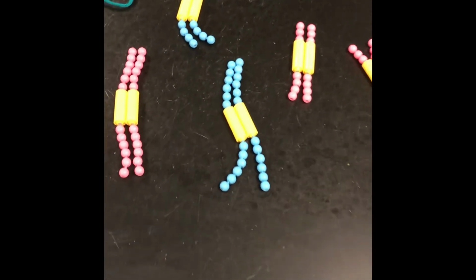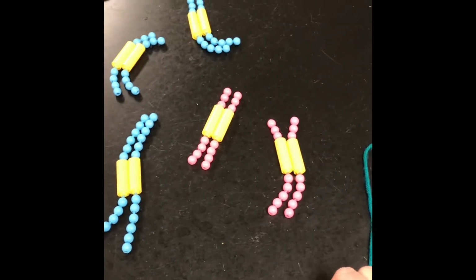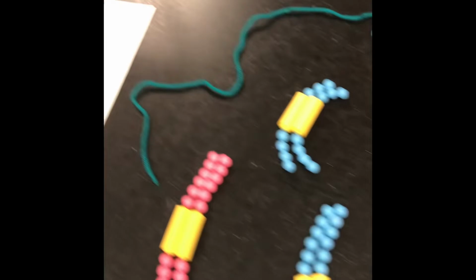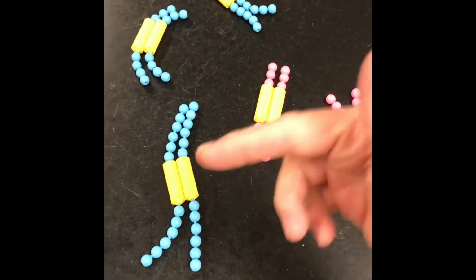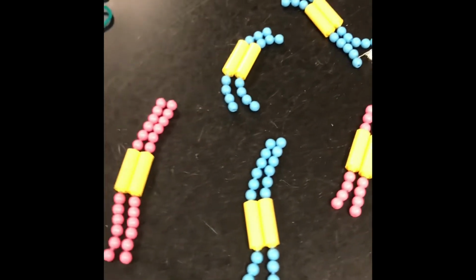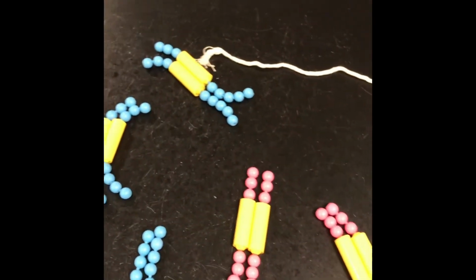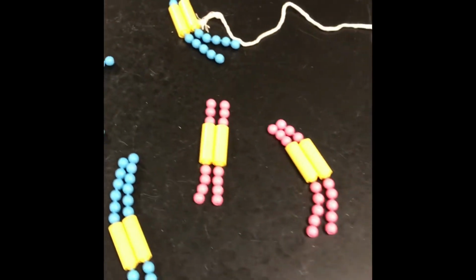And now we're going to move from prophase to prometaphase. Well, if we go into prometaphase, we're going to get rid of this nuclear envelope even more. It's almost completely disintegrated. Prometa. Now, I don't have spindle fibers here. Actually, I do have a couple that we can show. These little spindle fibers, aka microtubules, that are kinetochore microtubules, they're going to grab on like this and start to move each sister chromatid pair and kind of get them closer to the middle.